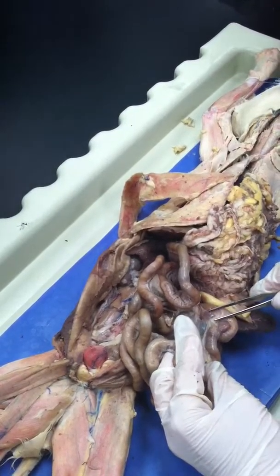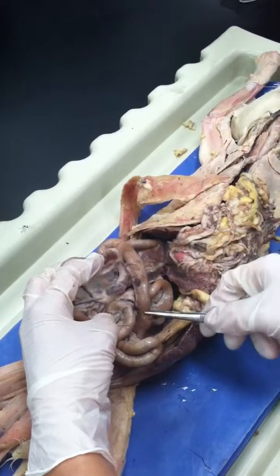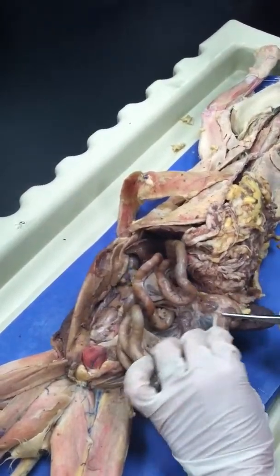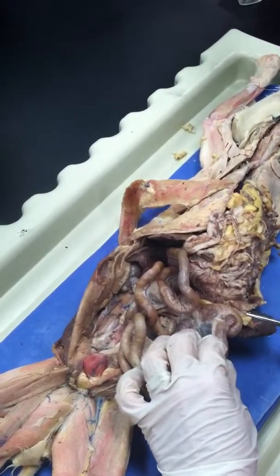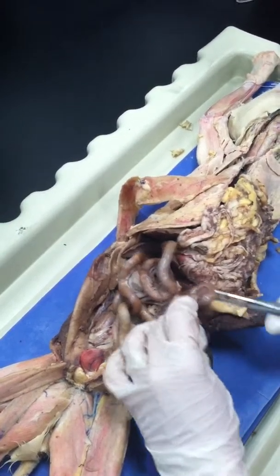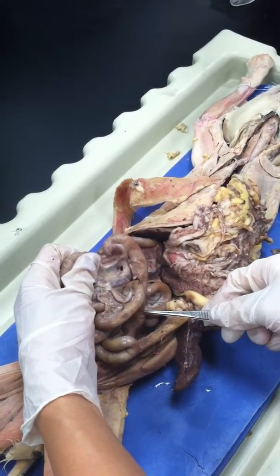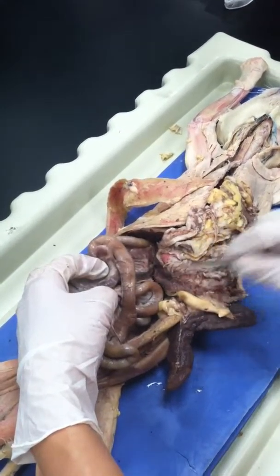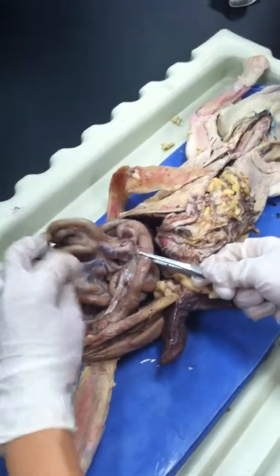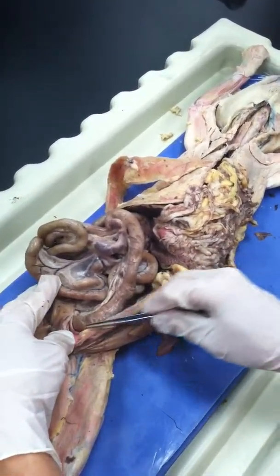Go up. Where is the large intestine? Show me the large intestine. Okay, this one. This is the transverse, and then you have your descending. Before the transverse should be the ascending, so it should be here, a small piece. No, no. If this is the cecum, make 1 inch ascending and then the transverse follows. So 1 inch ascending, and then transverse, and then you have your descending. Descending, yeah. It's not as classic as the human being. Okay, so you have all parts of the large intestine this way, and then the end is the rectum and anal canal.